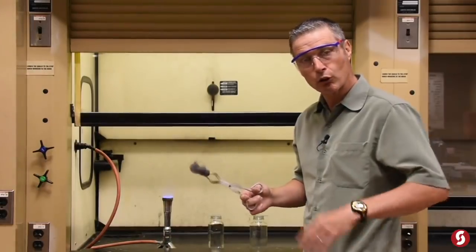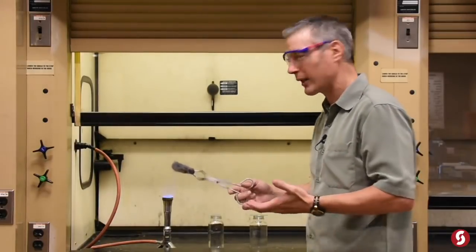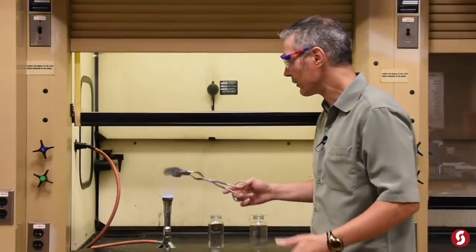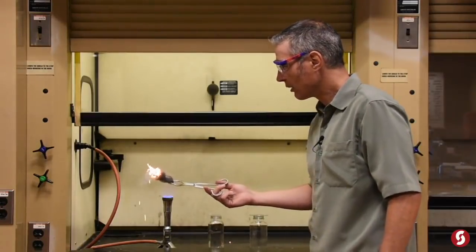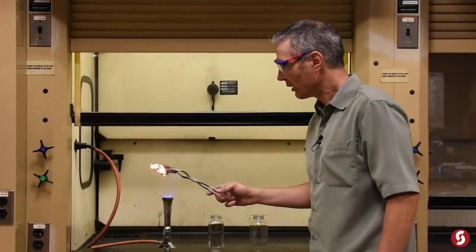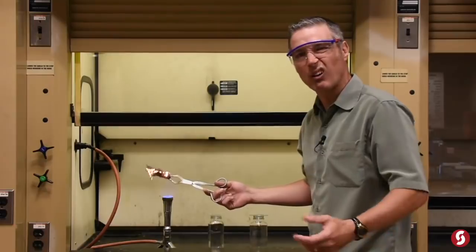Steel wool, mostly iron. You wouldn't think of iron burning. And to be honest with you, in air it really doesn't. It just kind of smolders a little bit. Nothing really all that outrageous.